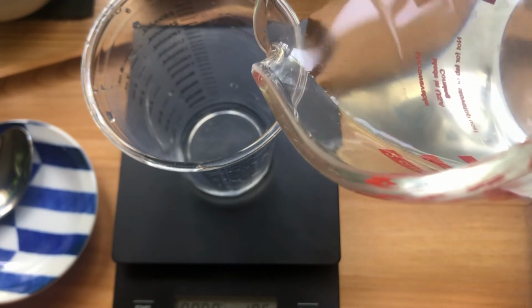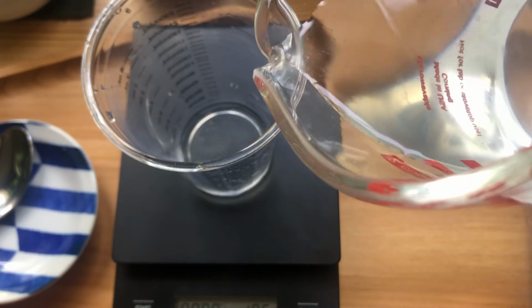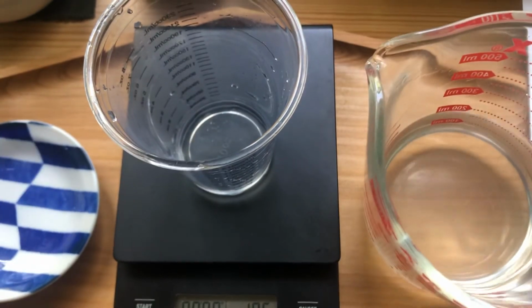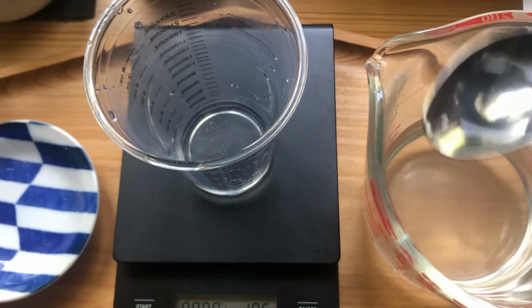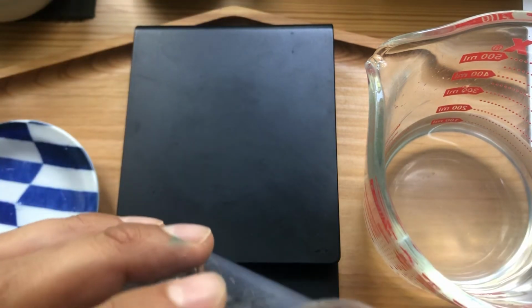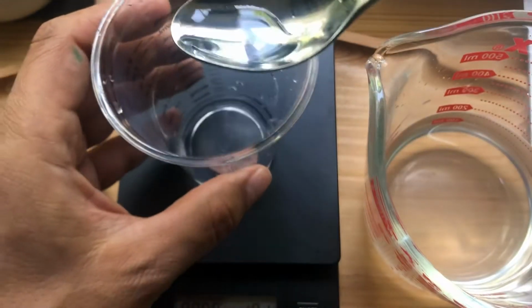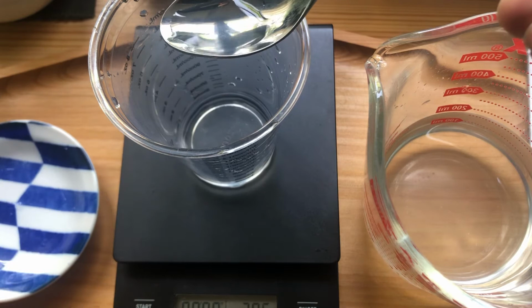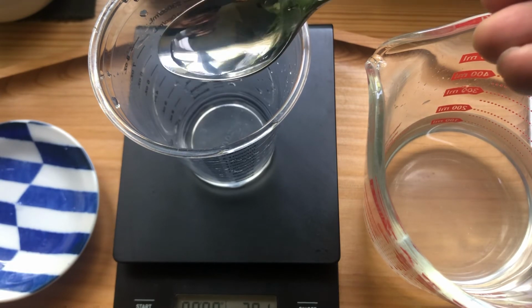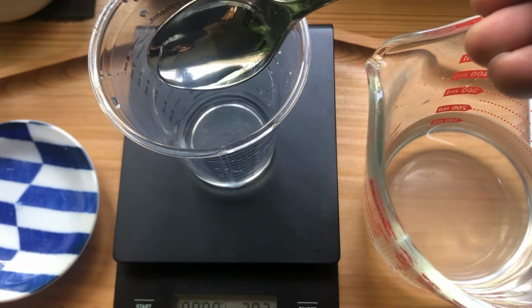And I'll look at the side of my container to see how well they align. For really concentrated solutions, you can't make that assumption anymore. Oh, a little over, oh well, what are you going to do? Okay, actually, let's pull a teeny bit out. I'm just trying to be precise here. What did we say? 21.6 milliliters.